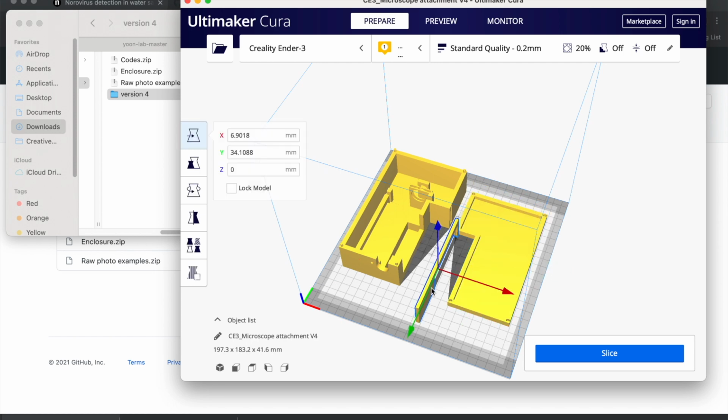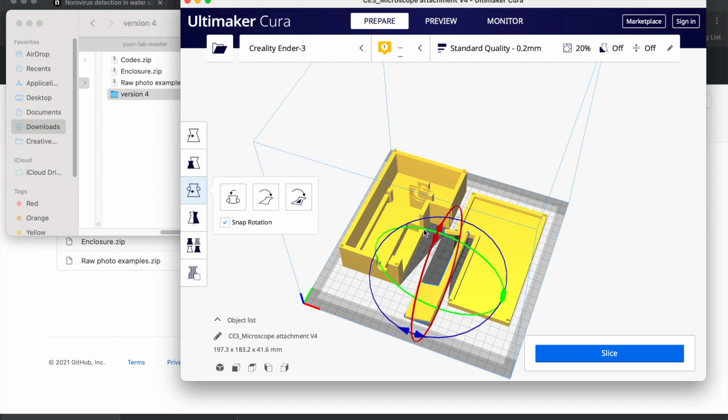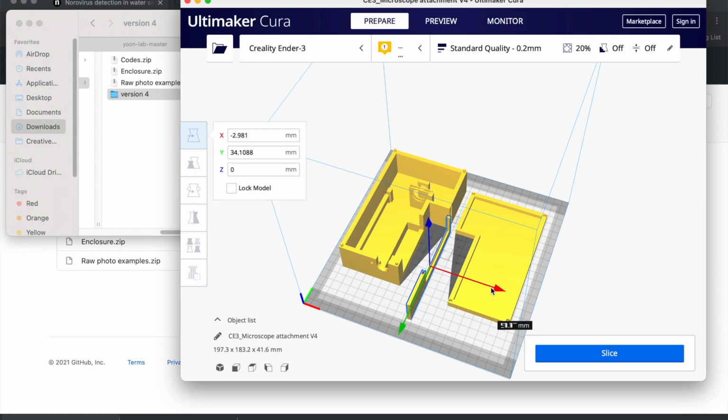Okay, and then this one, this is a slide holder. I would recommend printing it in this orientation, vertical, with the open side facing upwards, because there is a gap in there where you slide the glass into, so this is the best. Okay, so once I have these all ready, you click slice.